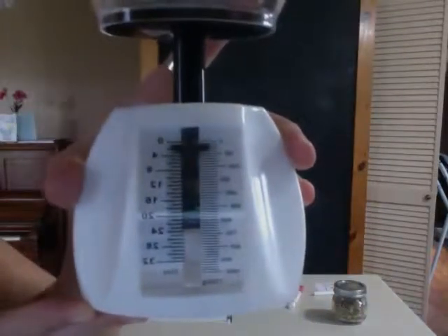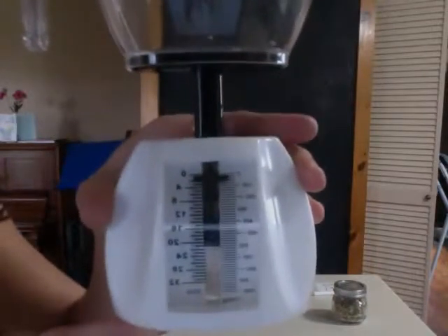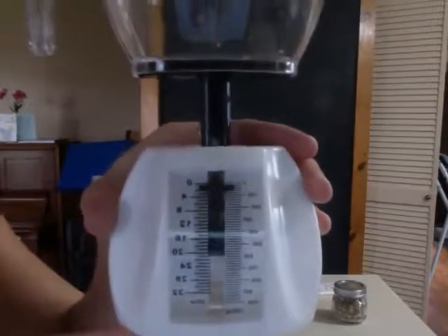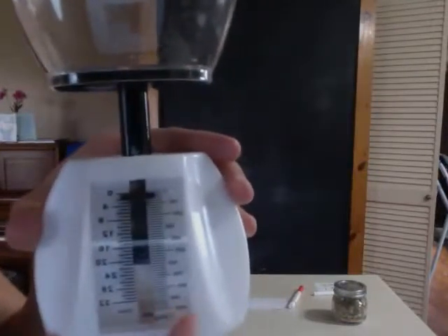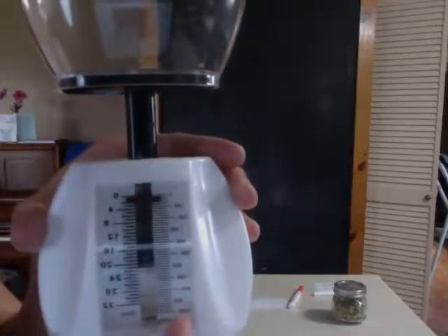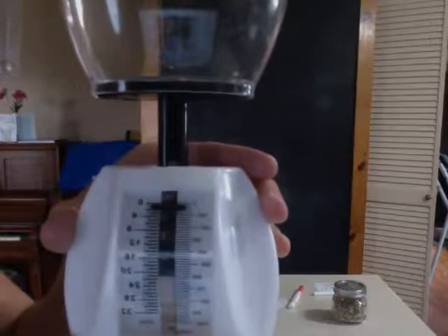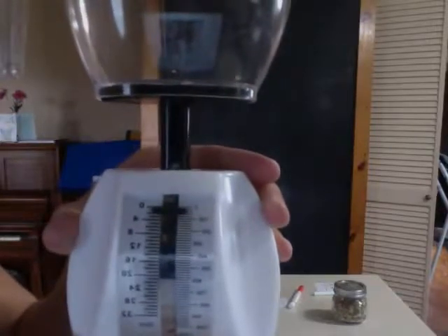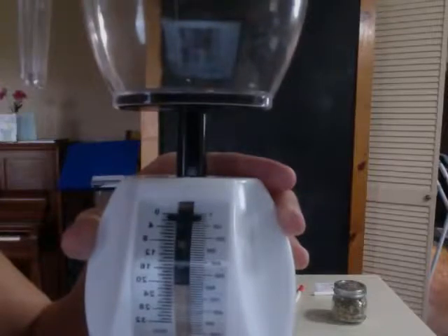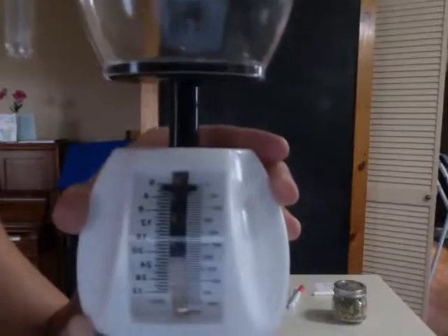So let's look closely first at this scale so you can get an idea of what I'm going to be looking at to take my measurements. A big part of this class is learning about taking measurements and making proper estimations. You can see on this side of the scale, grams are shown, and the maximum weight that it can hold is 1,000 grams, or 1 kilogram. And it's split up by groups of 100. You can see that they show 100, 200, 300, and in between those groups of 100s, we see 1, 2, 3, 4 lines, meaning that each small line represents 20 grams.